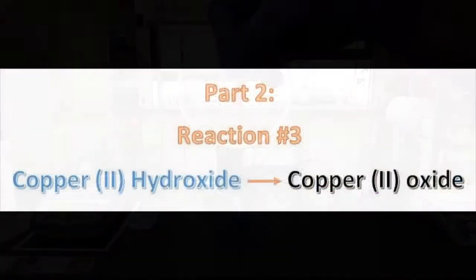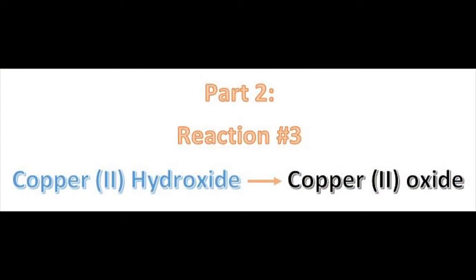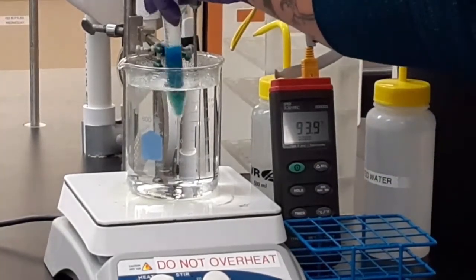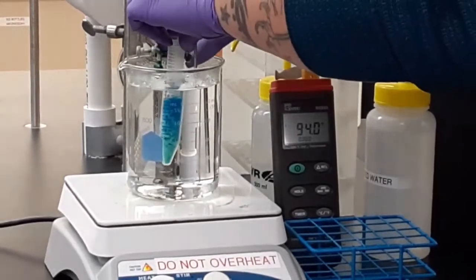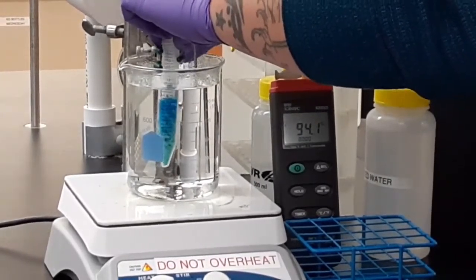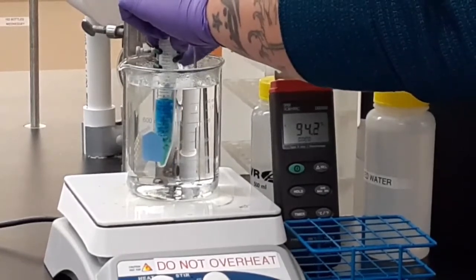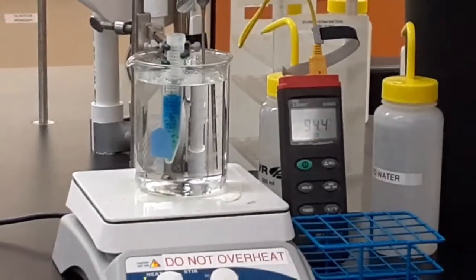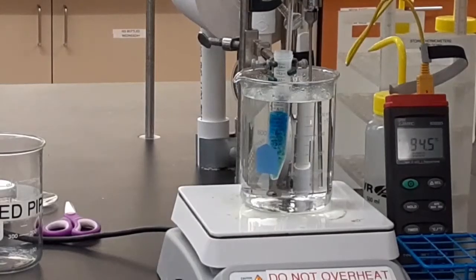Next reaction, copper hydroxide to copper oxide. Clamp your sample into the boiling water beaker on your hot plate. Now, a note here, you should have already started the water boiling. This should be the very first thing you do when you start your experiment. Start your hot plate. Make your water bath.